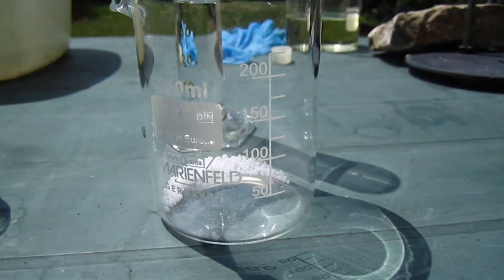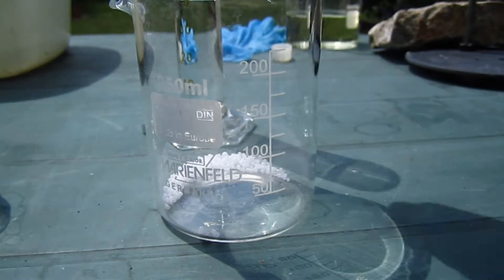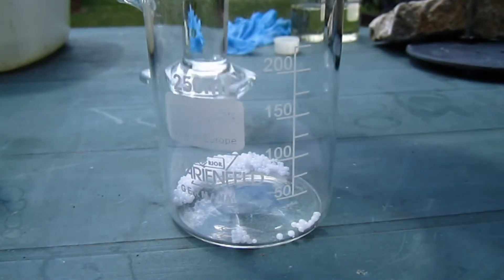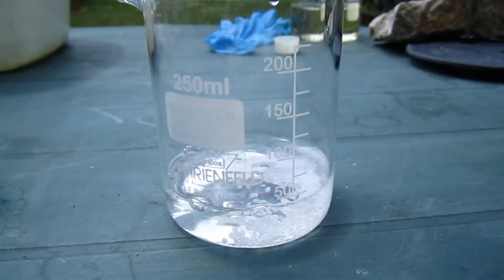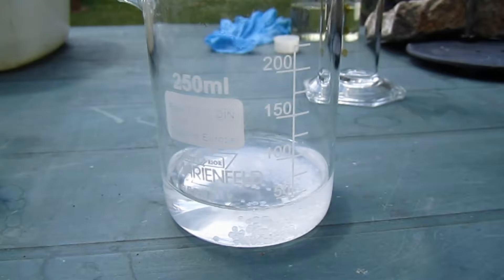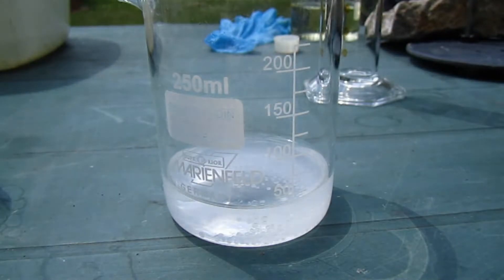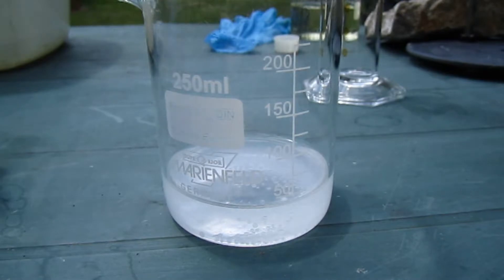So now I'm going to make some 10% sodium hydroxide solution. I got about 5 grams of sodium hydroxide and 45 milliliters of water. And this is to dissolve the free chlorobenzoic acid and hydrolyze any chlorinated quinones that have formed in this reaction, because there are quite a bit of side products in this kind of chlorination.